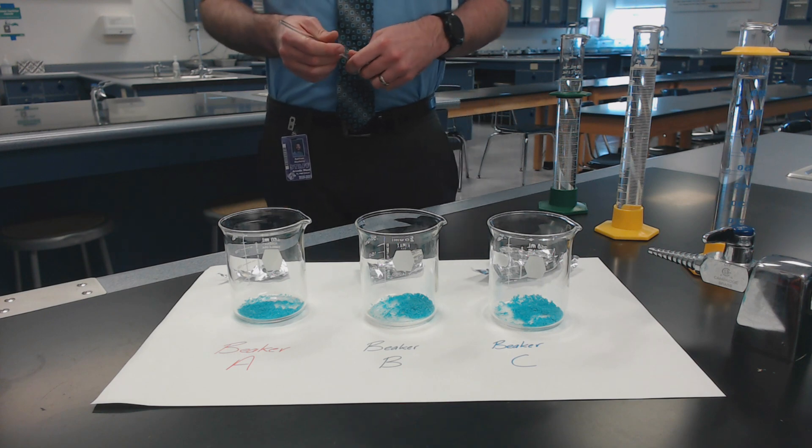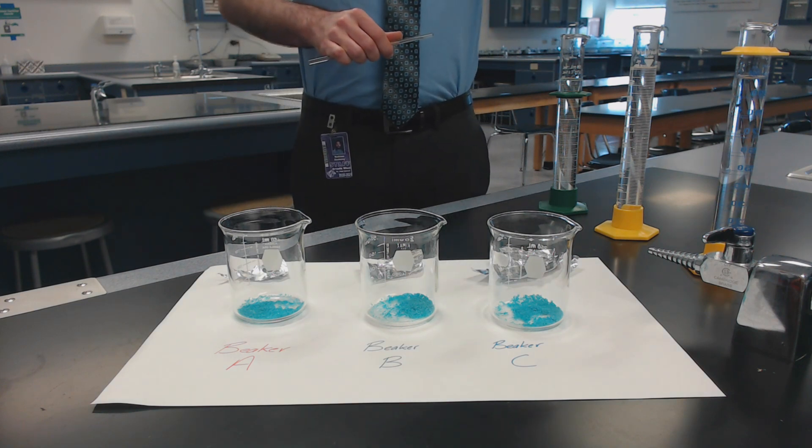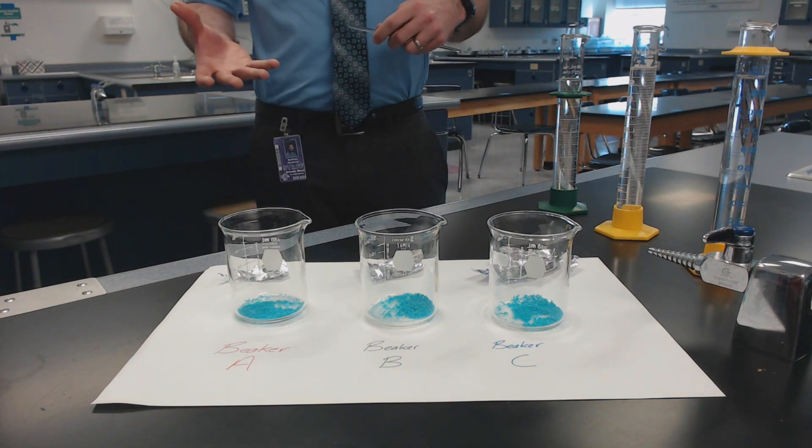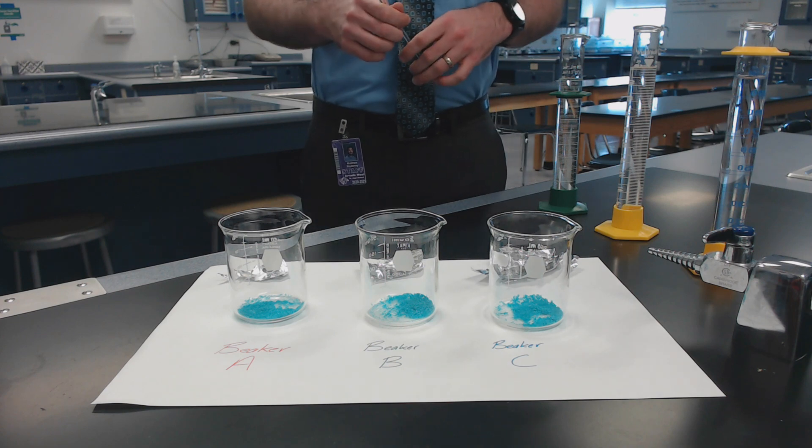Hello everyone, this is a demonstration of the lab that is part of your stoichiometry unit assessment. I will be showing you a little bit about what the reactions look like. I will also post some after pictures since the reaction does take a few minutes to complete.